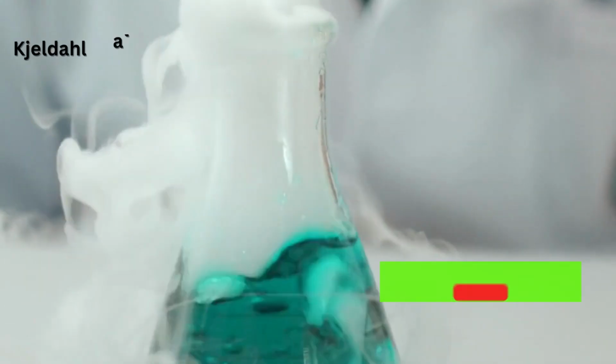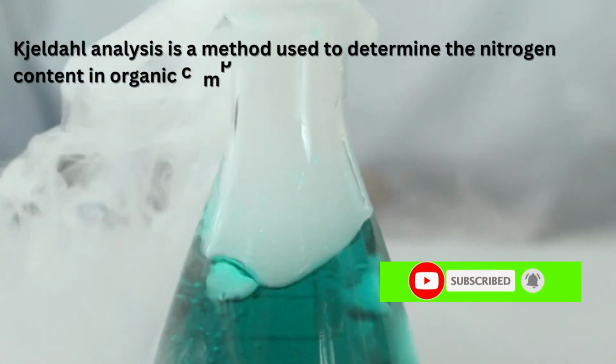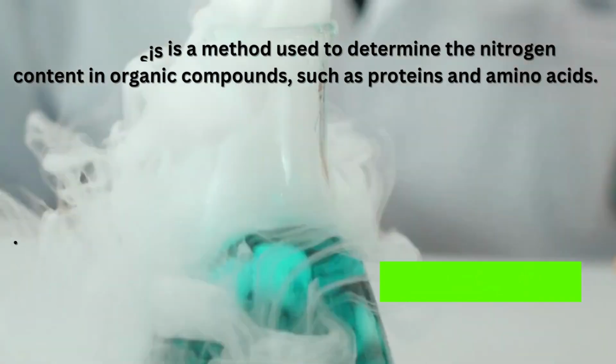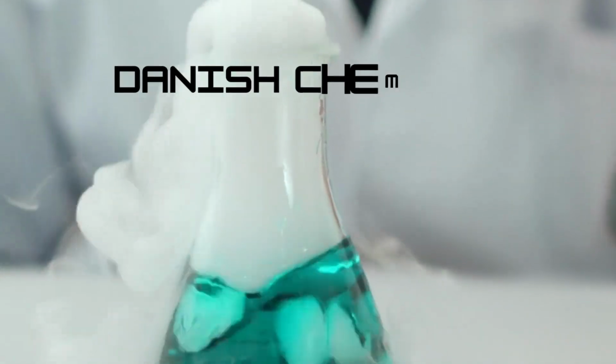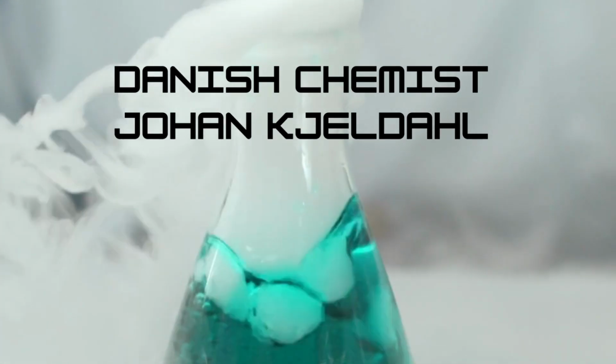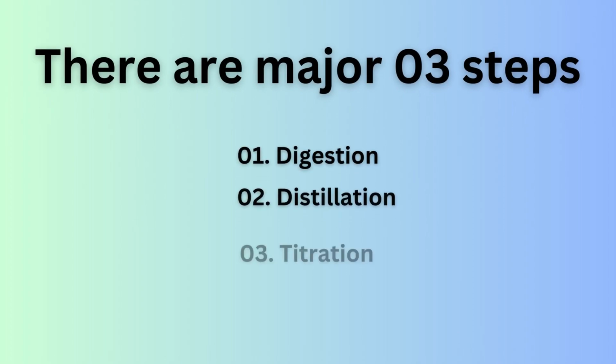Kjeldahl analysis is a method used to determine the nitrogen content in organic compounds, such as proteins and amino acids. It's named after the Danish chemist Johan Kjeldahl, who developed this technique back in the late 19th century. There are three main steps involved with Kjeldahl analysis. First step is digestion. Second step is distillation. Third step, titration. Alright, let's move on to the step-by-step process of performing the Kjeldahl analysis.